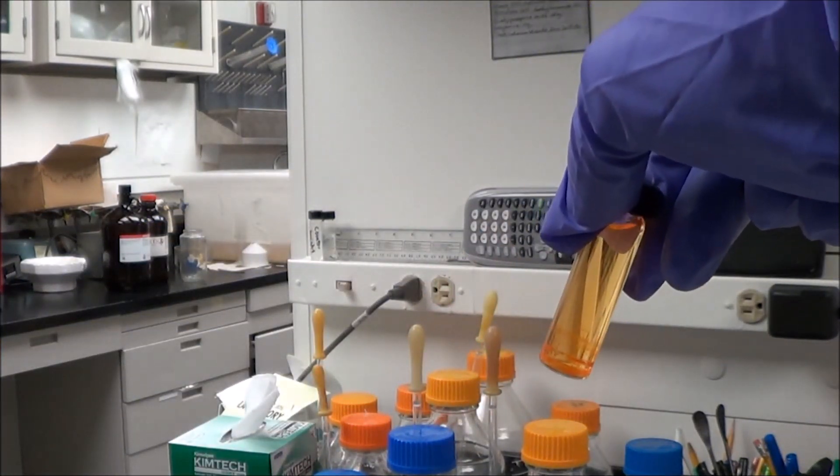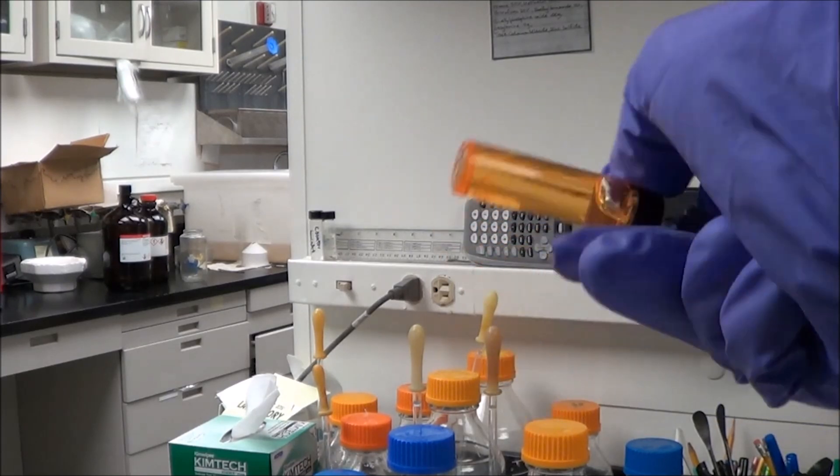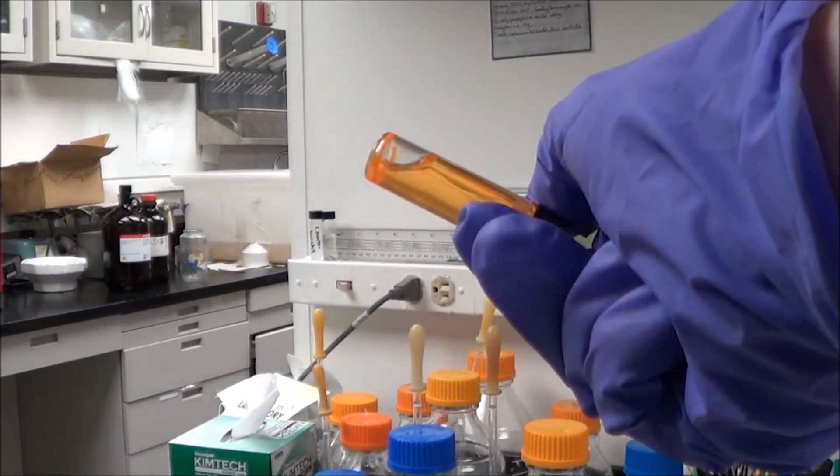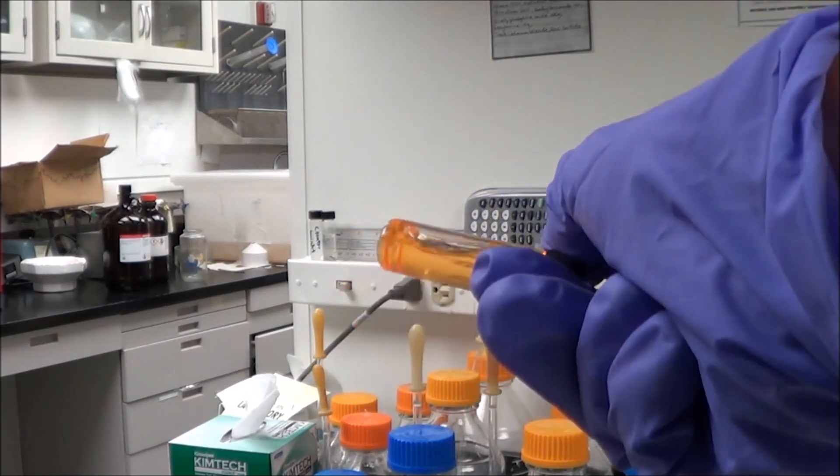The dots, if this process has gone well, just go straight into the water, and you can see that here. I don't have to do too much, just stir it a little bit, and the dots are going right in, and you can probably even tell that they're quite bright.